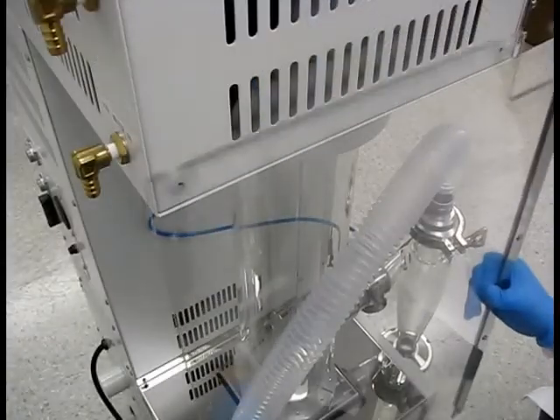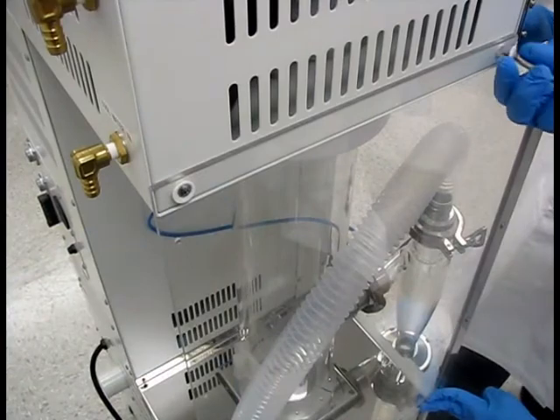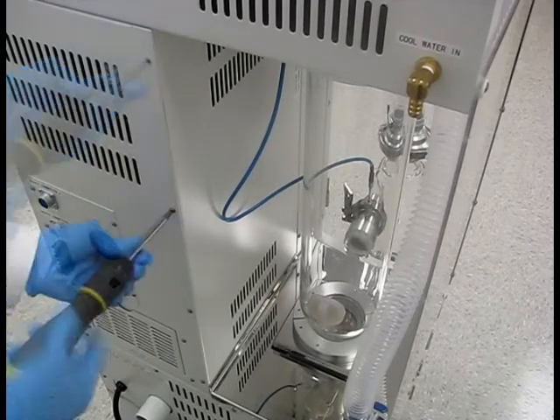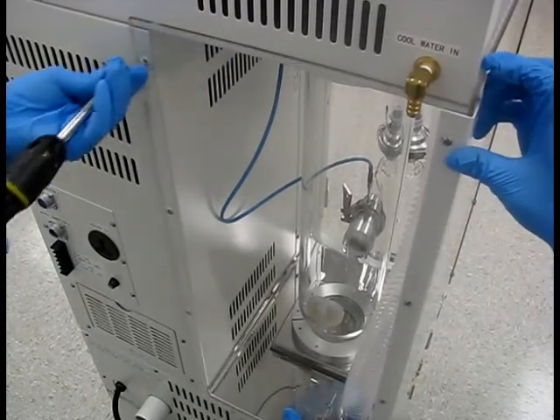Install the safety cover starting with the side panel and apply the appropriate screws. You will need to remove and replace the screws from the rear of the machine before installing the rear panel. Apply the longer replacement screws to secure the rear panel.